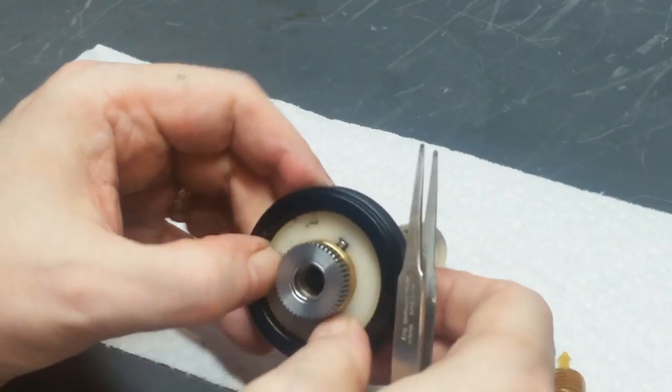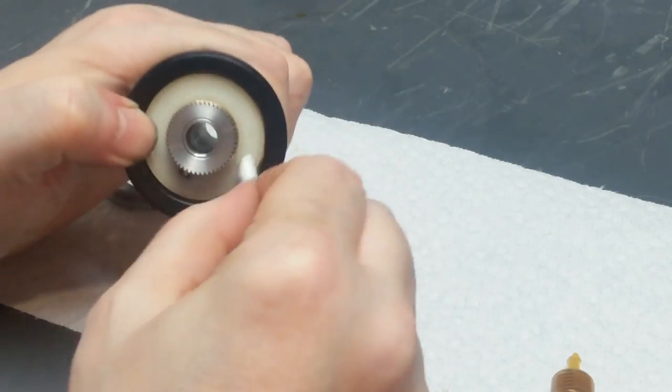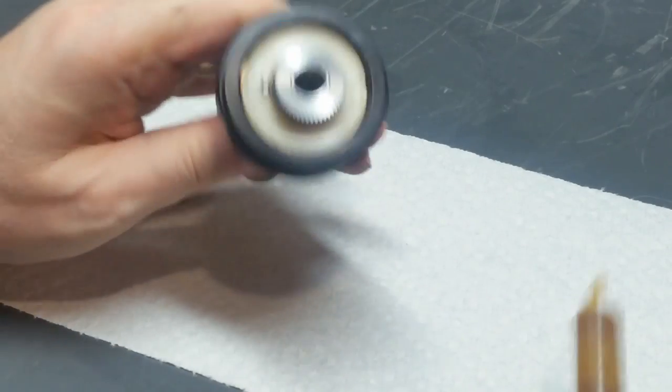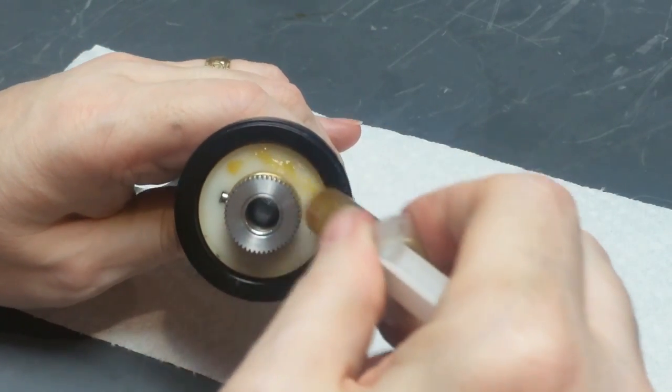There. And she's in there. Okay. Next step is to put a coating of grease on this.